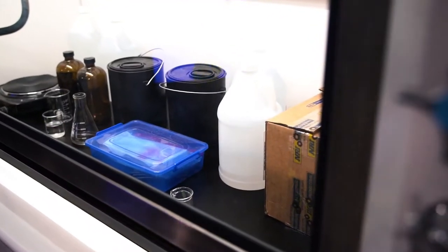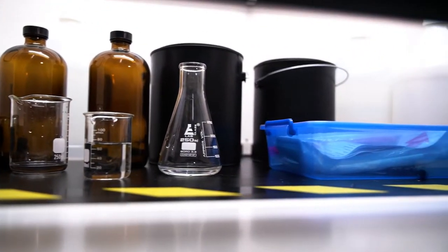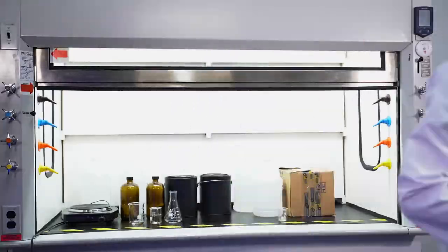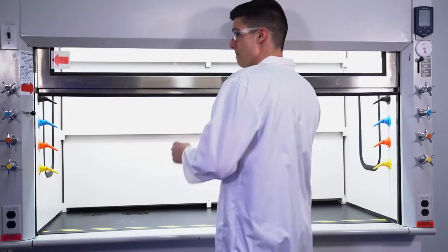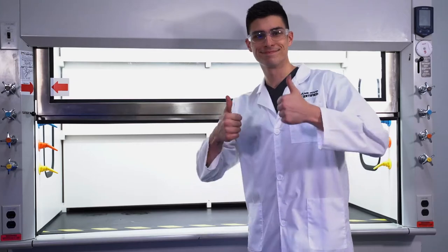Do not use the fume hood as a storage cabinet. Not only does it take up valuable work area, but more importantly, bottles, flasks, and other equipment blocks the baffle slots and air flow across the work surface.